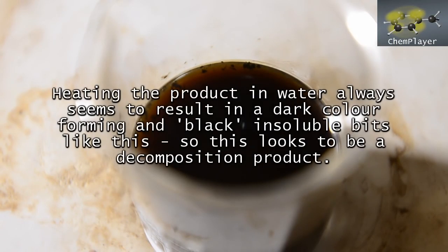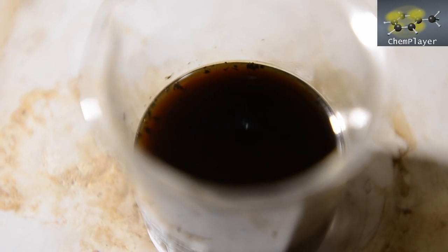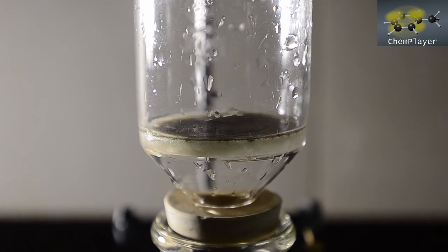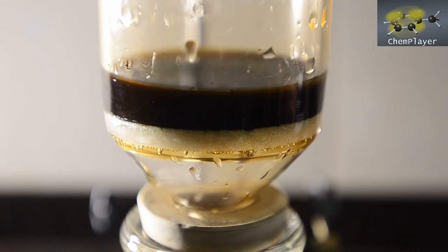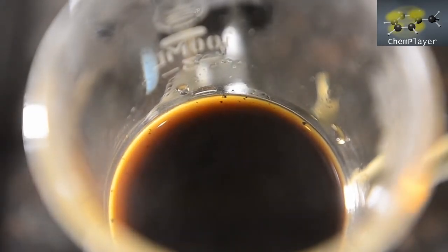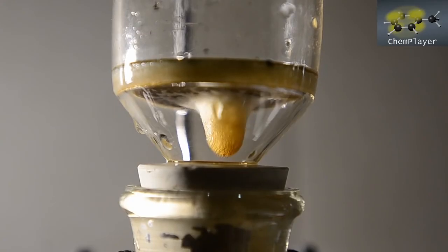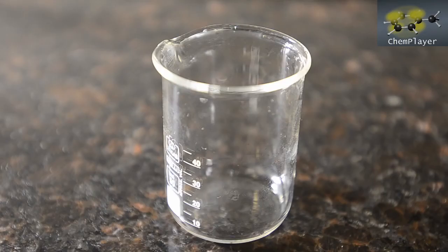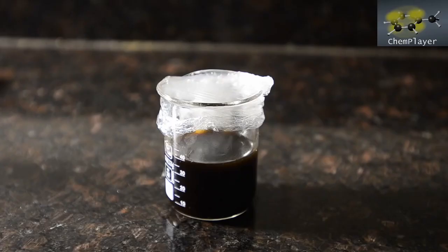But as you can see, there are some dark black colored insoluble impurities floating around. So let's filter the hot mixture and remove these first. Okay, we've captured the black bits. Here's the hot filtrate. And just as before, we'll chill this down now for a few hours and see if we can get a pure product to crystallize out.